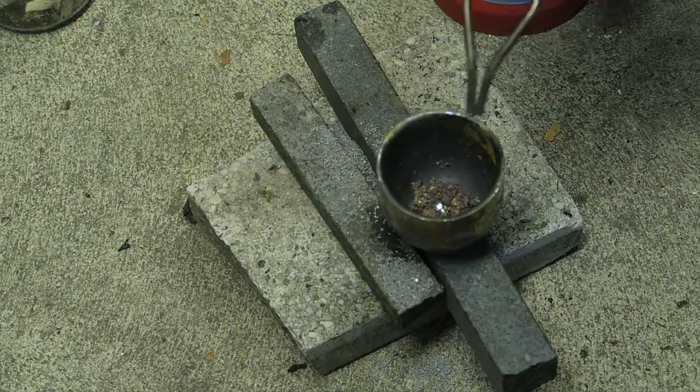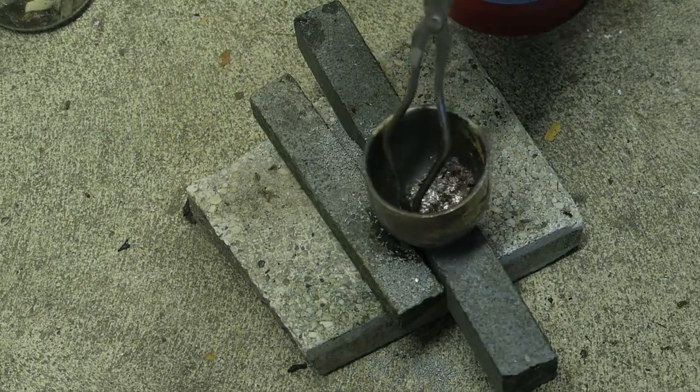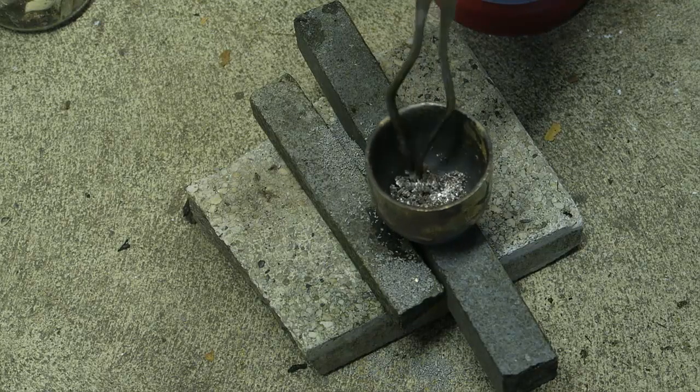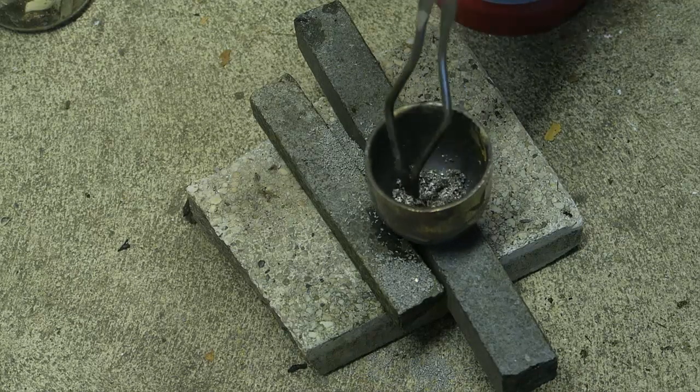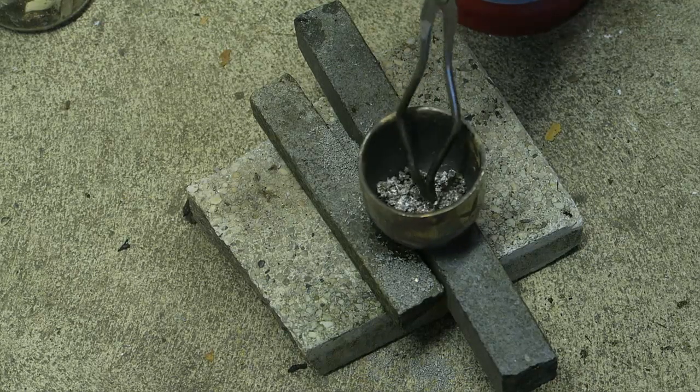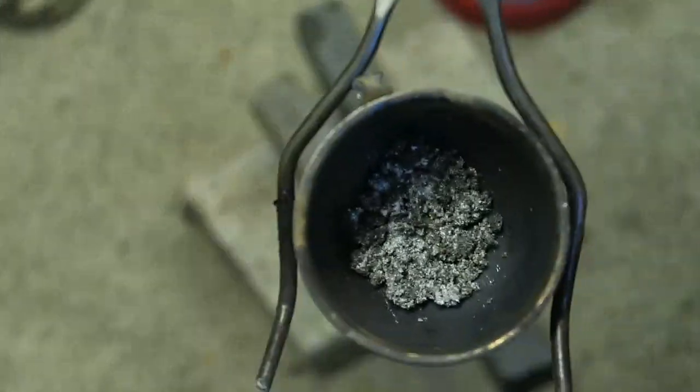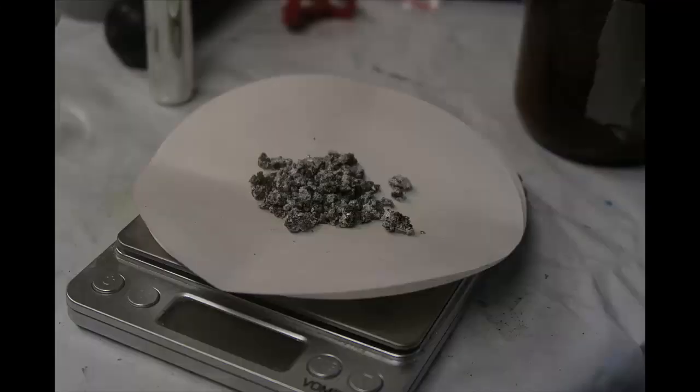I weighed out 5 grams of aluminum and heated it with my blowtorch. As I got to the semi-liquid state, I added the gallium alloy and mixed things thoroughly up. It's then re-molten to finish it up. At the end I had a crumbly alloy which looked like this.